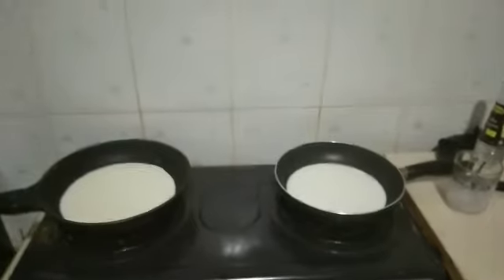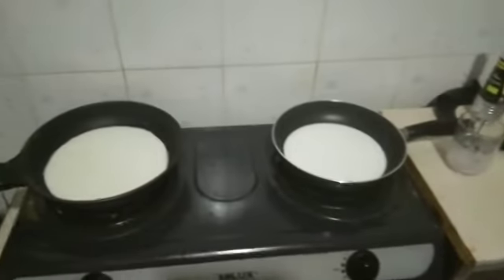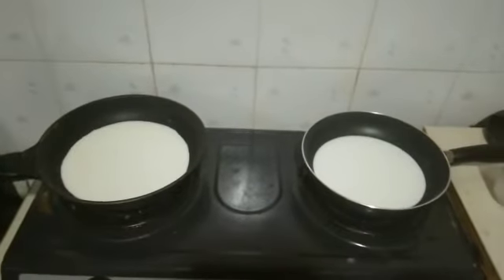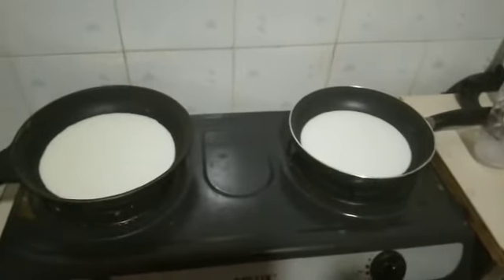Now we are heating up the milk. Remember, low fat, full cream. The question is, why are we heating this milk? The precipitate often contains ions that were trapped when the precipitate was formed.